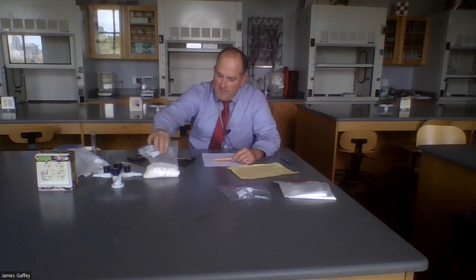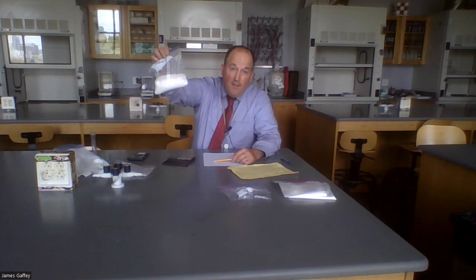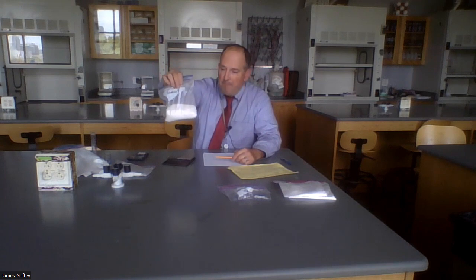Okay, now that we've calculated the molar masses of both sucrose and sodium chloride, the one that is the bigger sample was 329.5 grams. Now, our calculated molar mass for sucrose, 342, is a little bit off, but students, percentage-wise, that's still well within reasonable laboratory error.